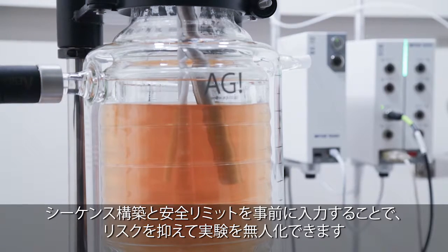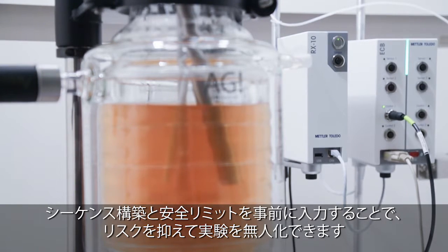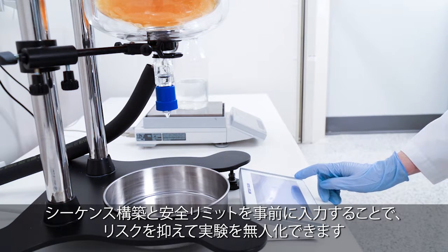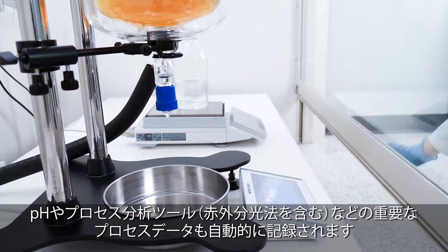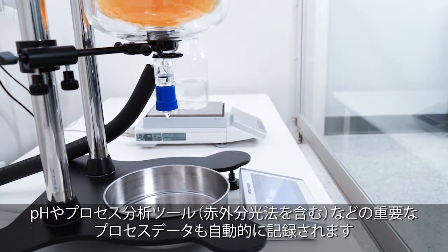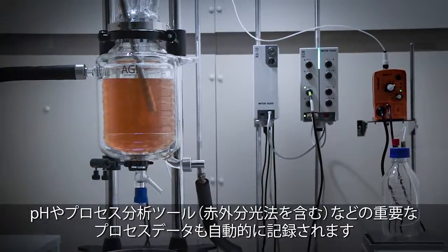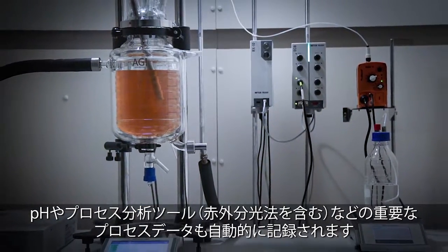By pre-programming recipe steps and safety limits, experiments can be run unattended without risk. Process data is automatically captured along with data from other sensors such as pH or process analytical tools, including infrared spectroscopy.